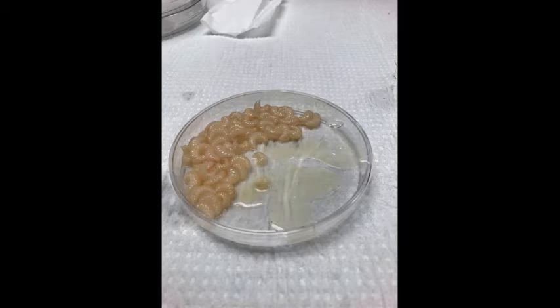They had a barbed stinger like a worker, not a smooth stinger like a queen. And so this just shows the kind of output we can get from these in vitro larvae, that we can get them to become normal-ish walking, talking bees. And so we can compare how different factors during development affect what happens to these bees.